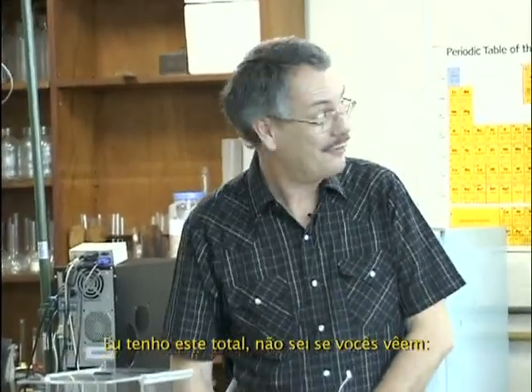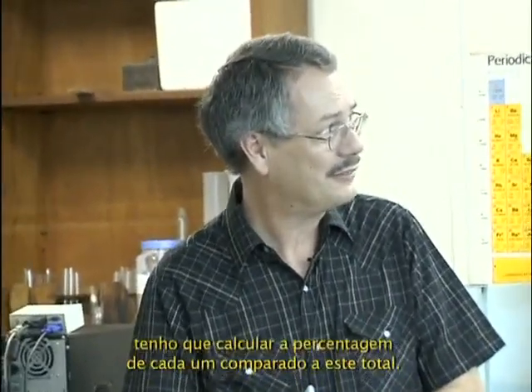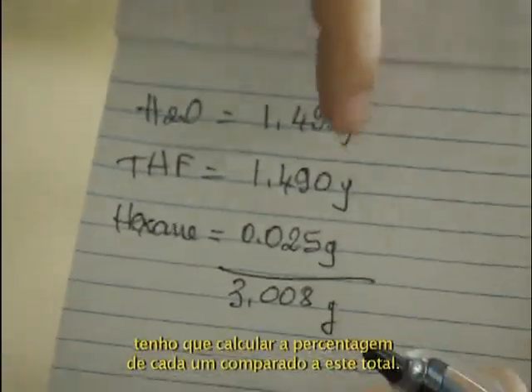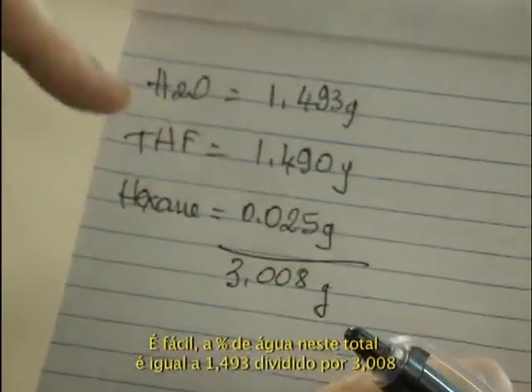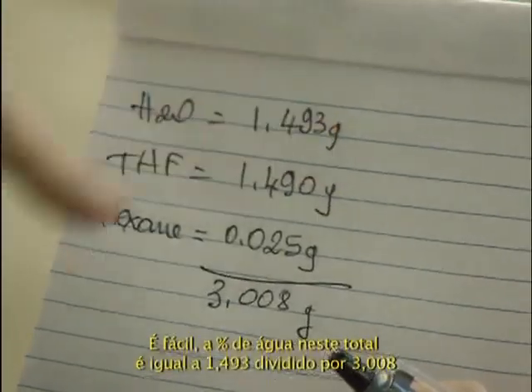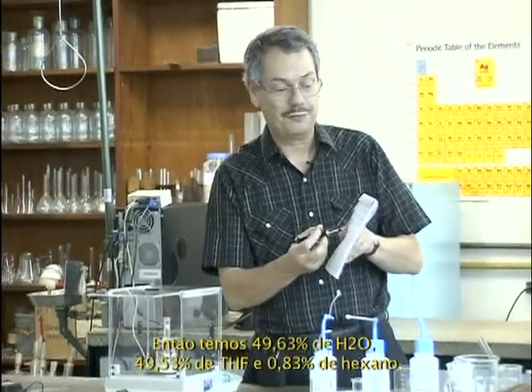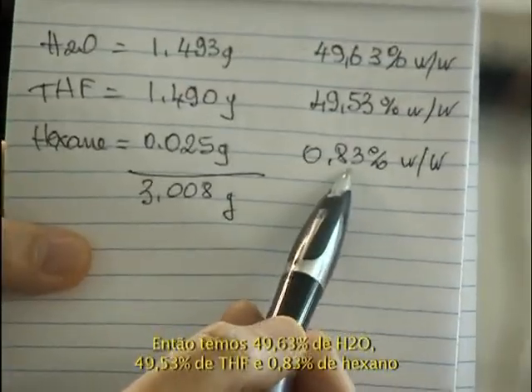I have this total. I have to calculate the percentage of each compared to this total. It's really easy. Percentage of water in 3.008 gram is 1.493 divided by 3.008. So you see 49.6, 49.53, 0.83.